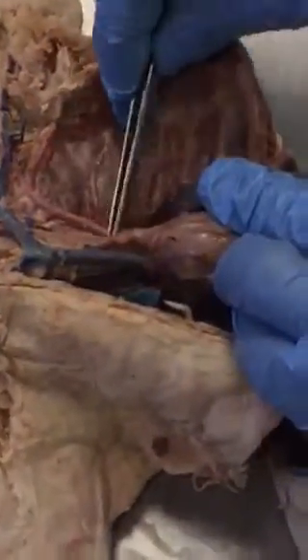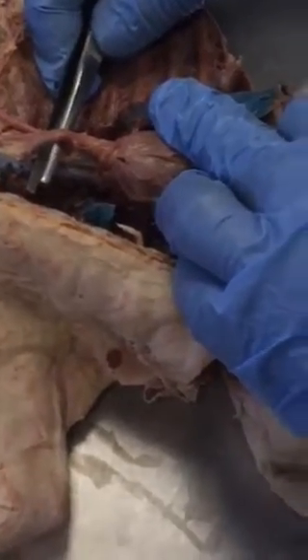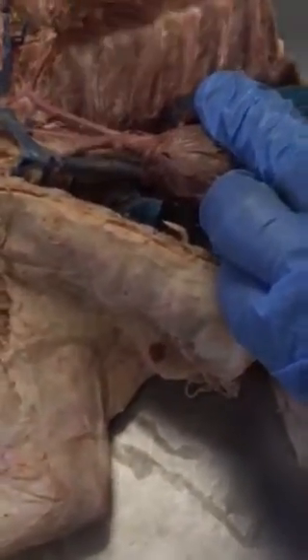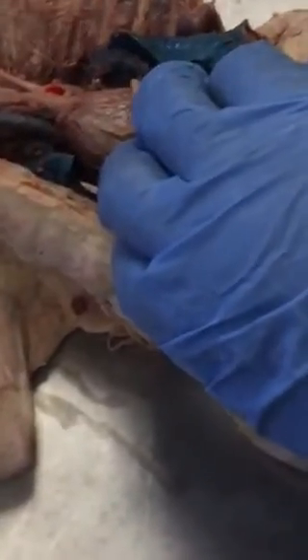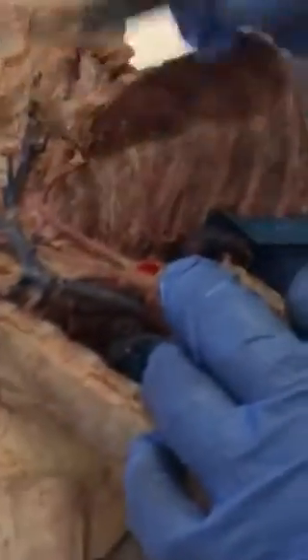Now for the right side. What are these things underneath of it? The IMA and... Internal mammary. Okay, and then what's this RA? That's radial artery, radial vein. Okay, I mean ulnar vein, ulnar artery and radial artery.